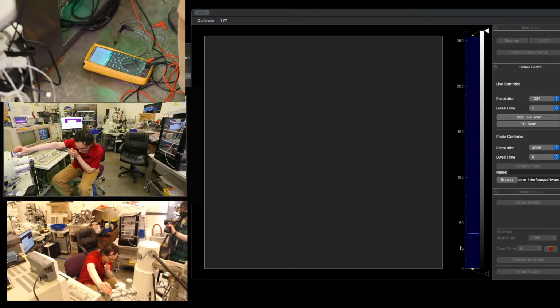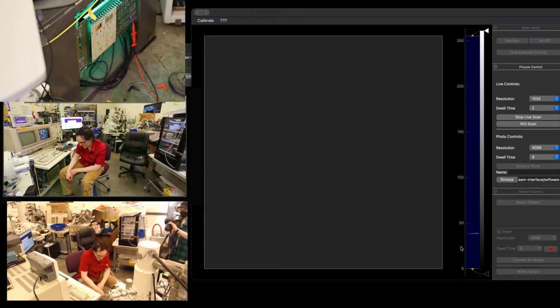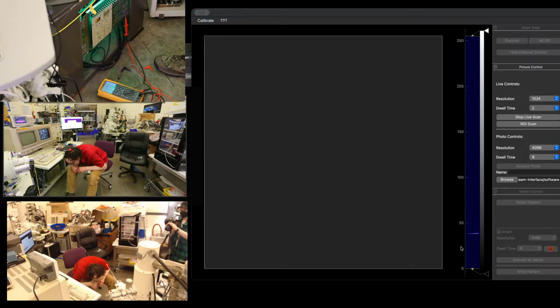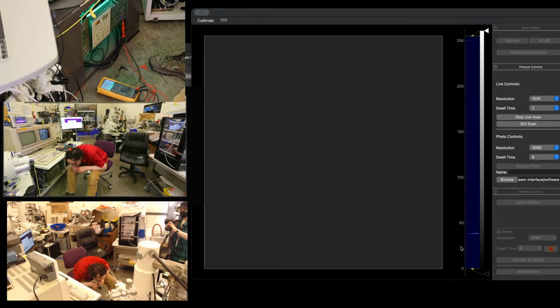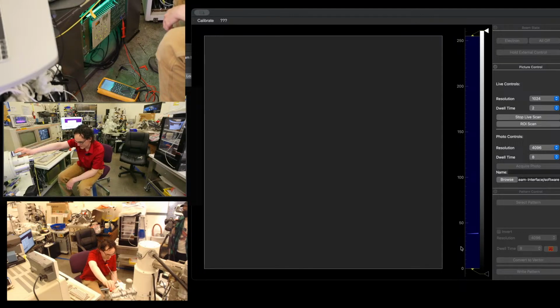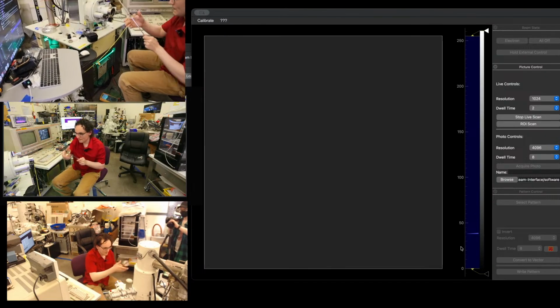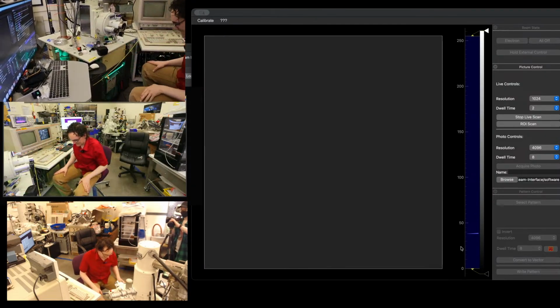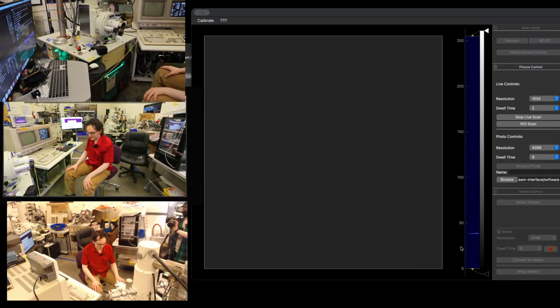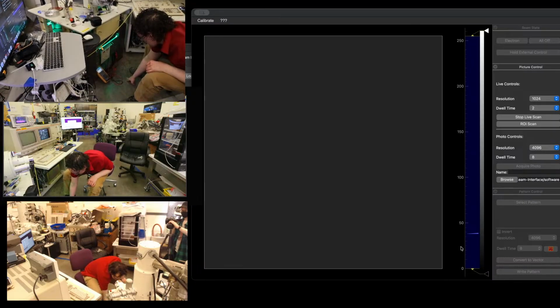Pump it down again. Yeah, not changing. And I am on PG2, which is what I want to be on. Huh, interesting. Don't really know what that was, but we're stable now. Okay, we're gonna proceed. If it does reoccur, we're gonna look into it more. So we'll go ahead and leave the meter on it.